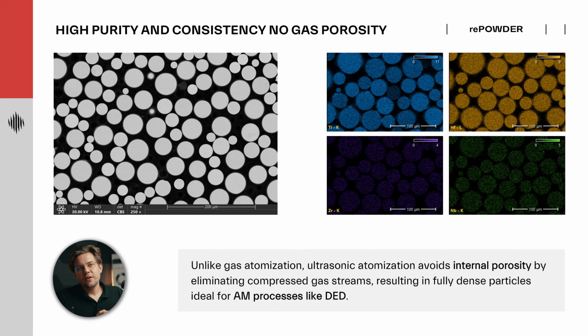Let's take a look at the cross-section of the powder. One of the typical defects in gas-atomized materials is so-called gas porosity. The particle itself is like a shell, so inside the particle you have a bubble of gas that was used initially for spraying. Such gas porosity can later be passed to the material, for example, in DED processing. It is much harder to get dense material with porous powder than with powder that is bulk. Not having compressed gas as a spraying medium in the ultrasonic method, there is no way of introducing gas porosity there.